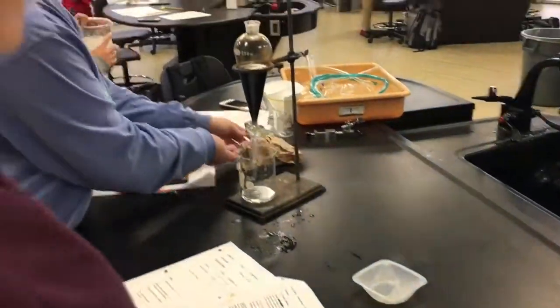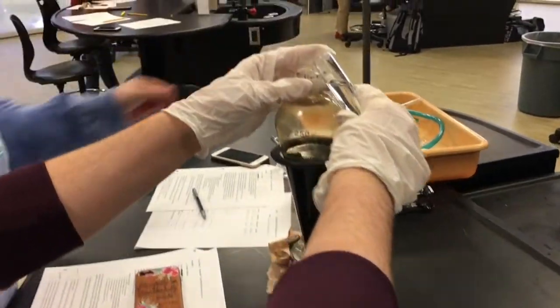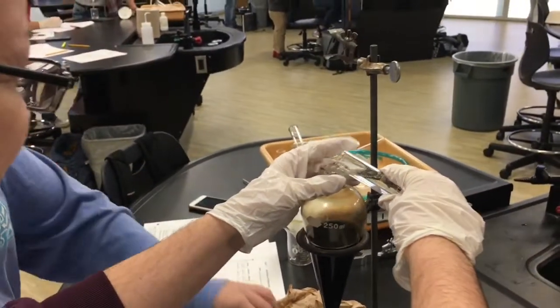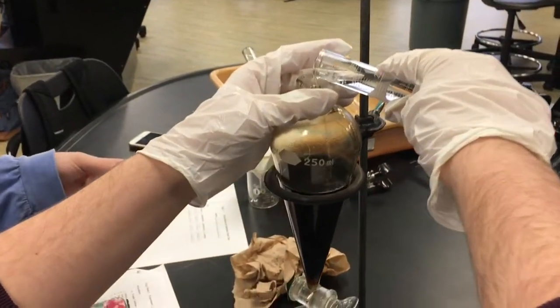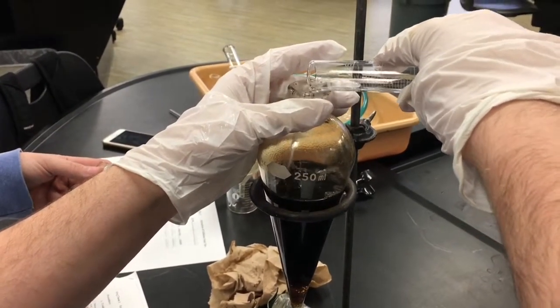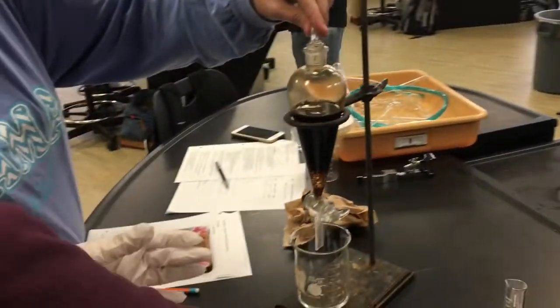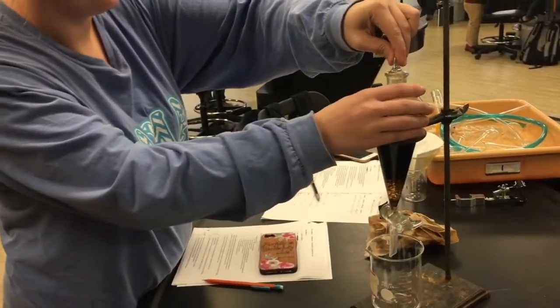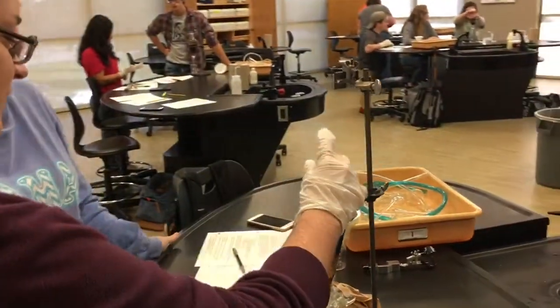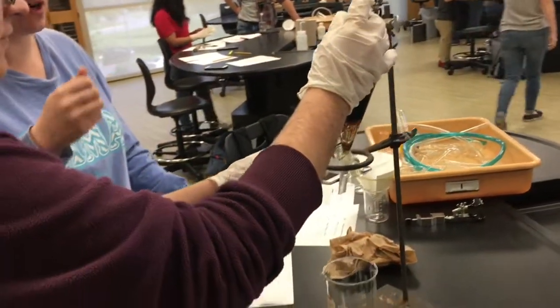We're going to add this back in there. Now this is going to make me nervous. It's good, it's closed, it's not leaking. Okay, now you're going to have to shake it up, Lori. You can do swirling stuff, and then we'll turn it over and do the whole thing.